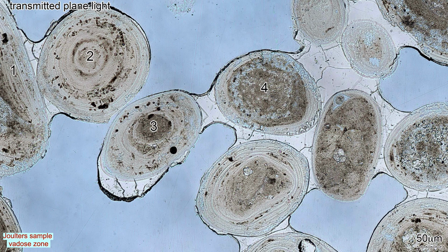Several ooid pairs, including ooids 1 and 2 and ooids 3 and 4, are joined by cement with concave final surfaces. However, ooids 2 and 3 have other cement crystals on their rims that have convex final surfaces facing open pores, marked by the red asterisks.